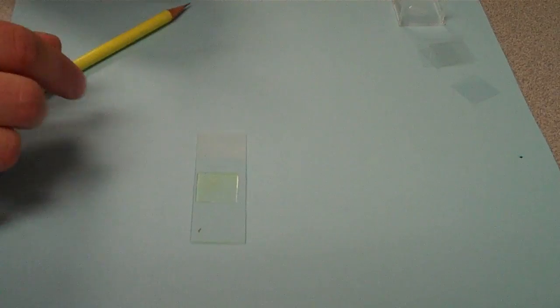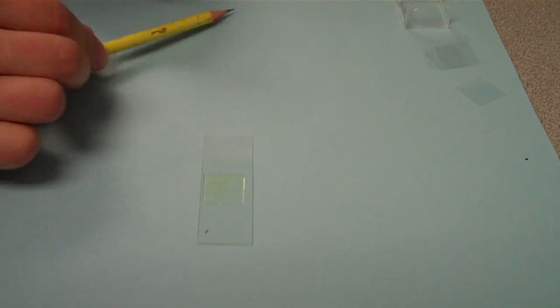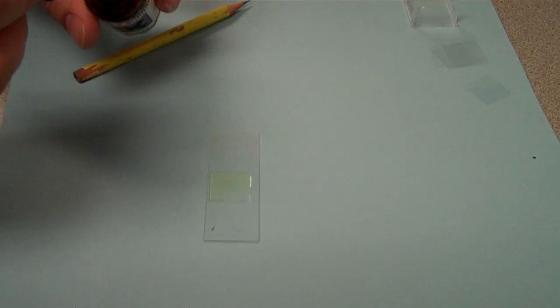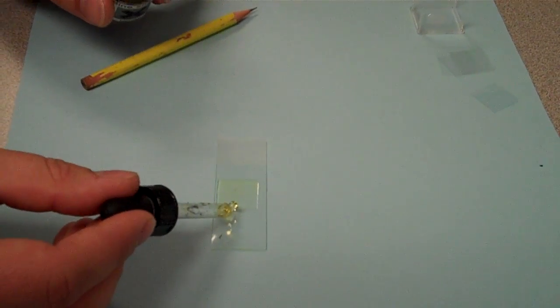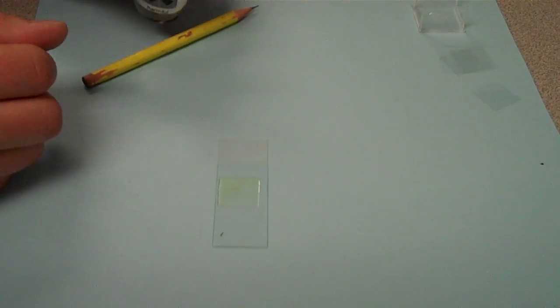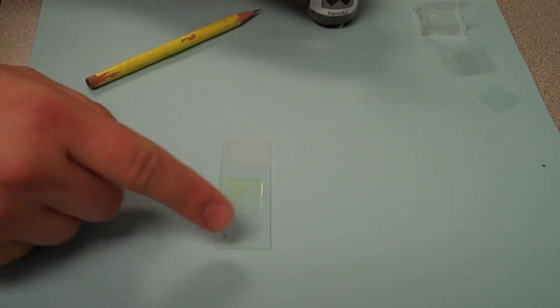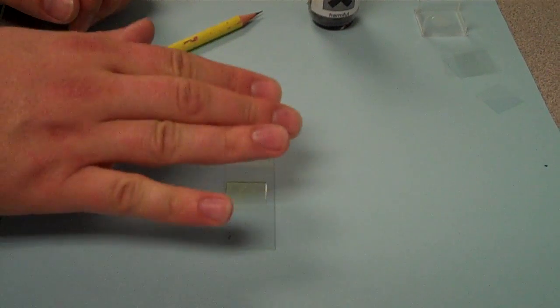If you didn't put enough fluid on there, and you don't have the whole slide kind of covered, sometimes what you can do is you can be a bit sneaky and just put a drop on the side, and it'll suck it in by capillary action. If you've got way too much, just use a bit of paper towel to dab up the edges.